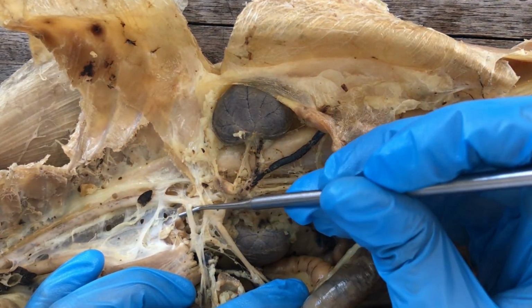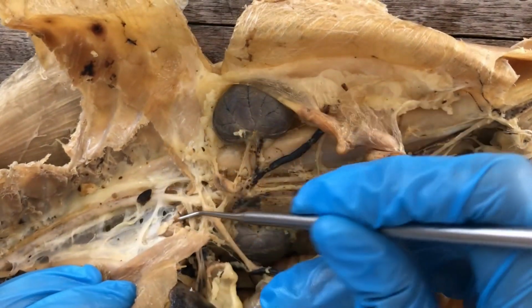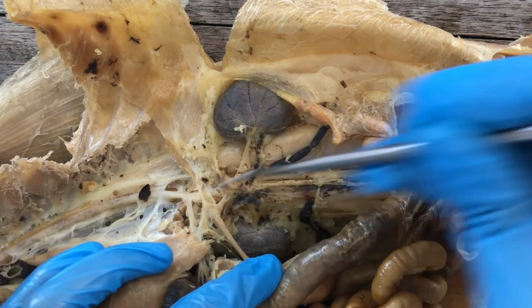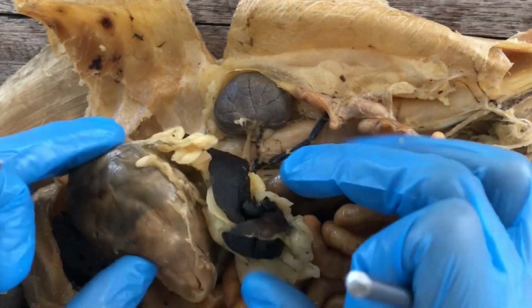The most anterior one would be the celiac artery. Just immediately once it penetrates the diaphragm and enters the abdominal cavity, it gives off the celiac artery, which will supply blood to the liver and the stomach.